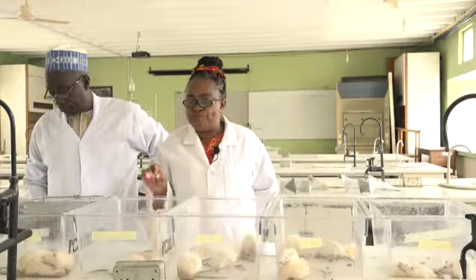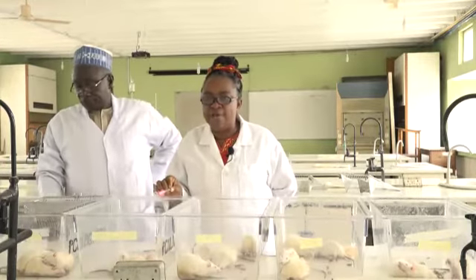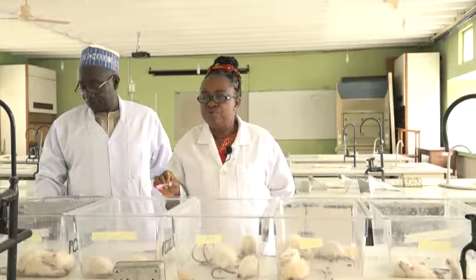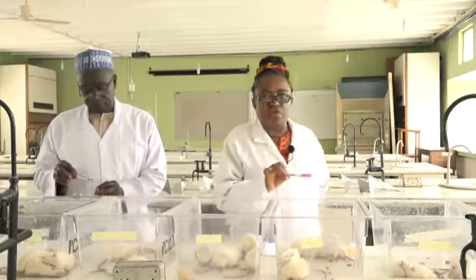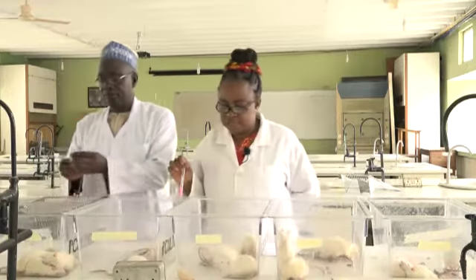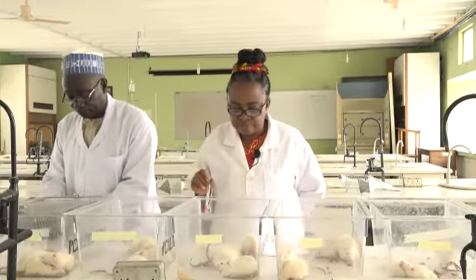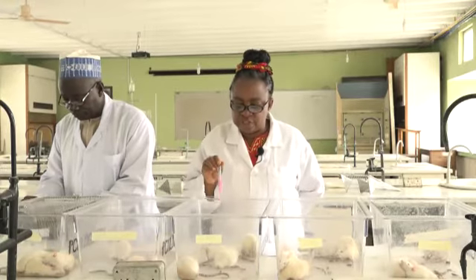Now, in this group, you have male rats too. He's going to poison them and immediately follow up with atropine. It's similar to what he has done before. So please, Mr. Mohammed, just go ahead and do your thing. I want you to pay attention to this cage. See the typical signs.